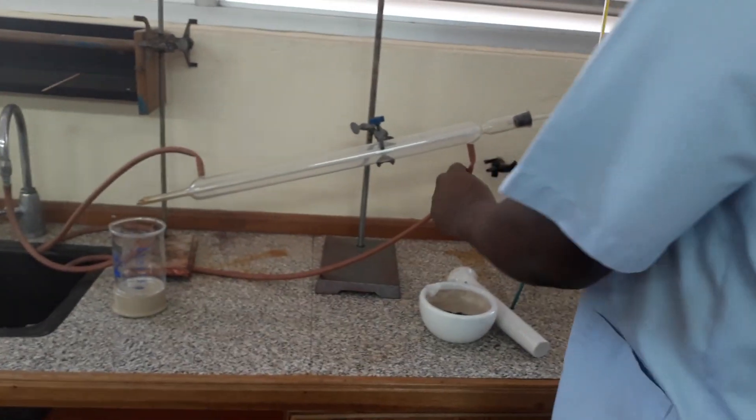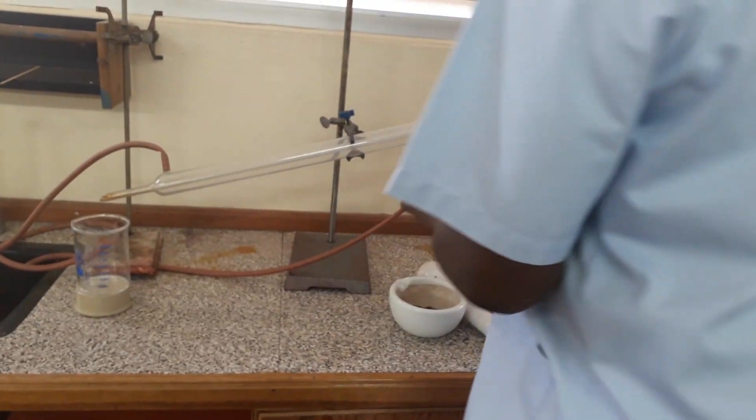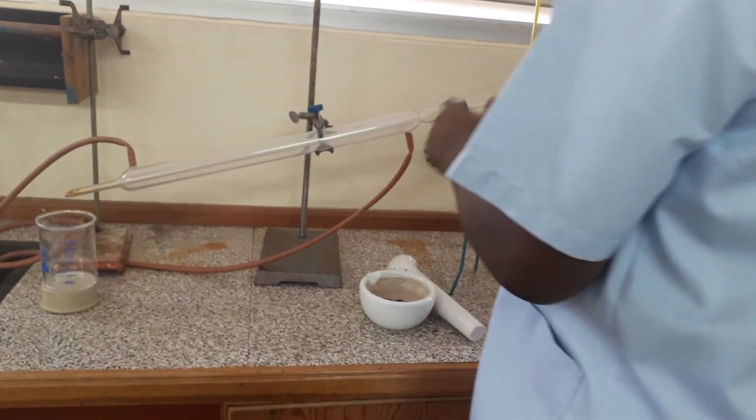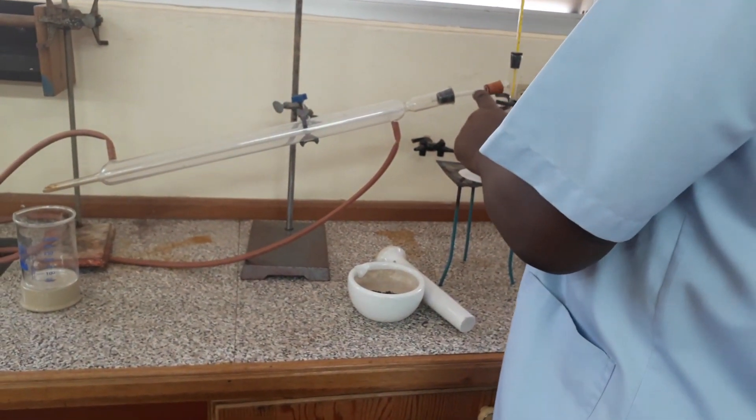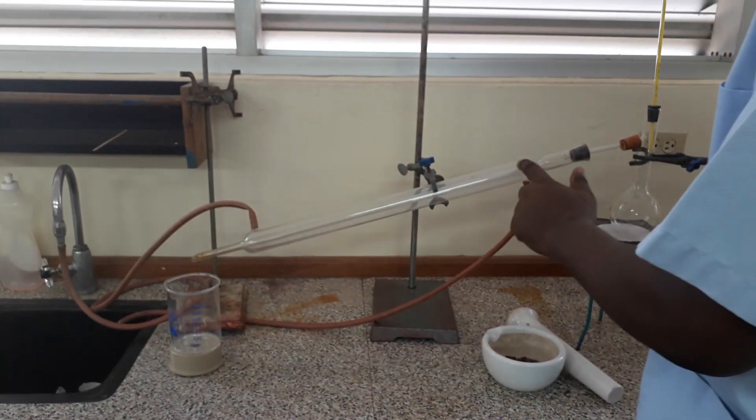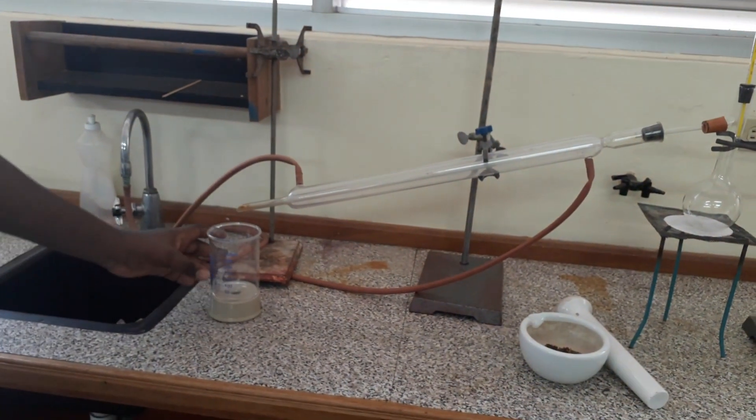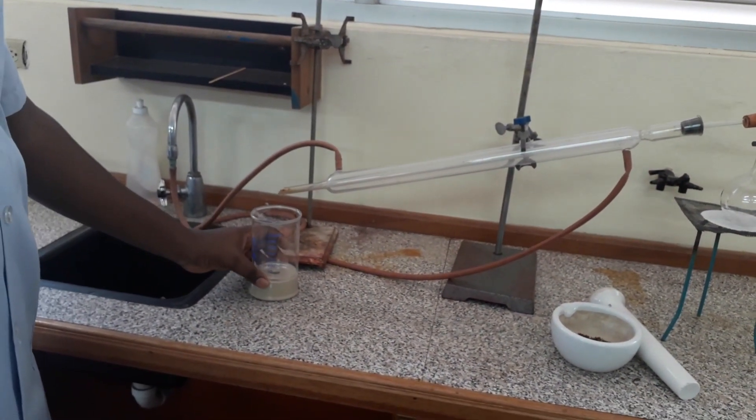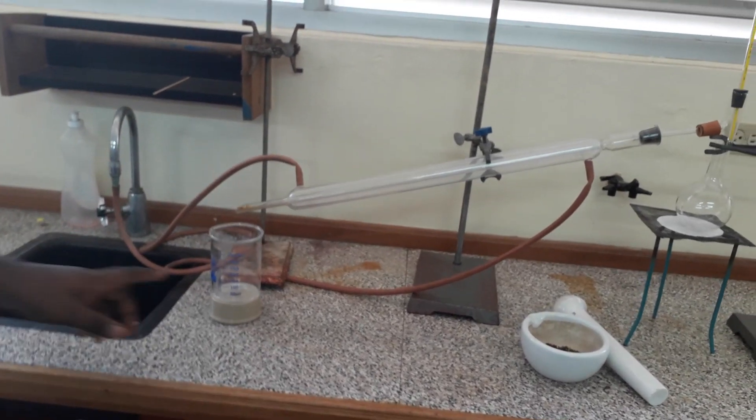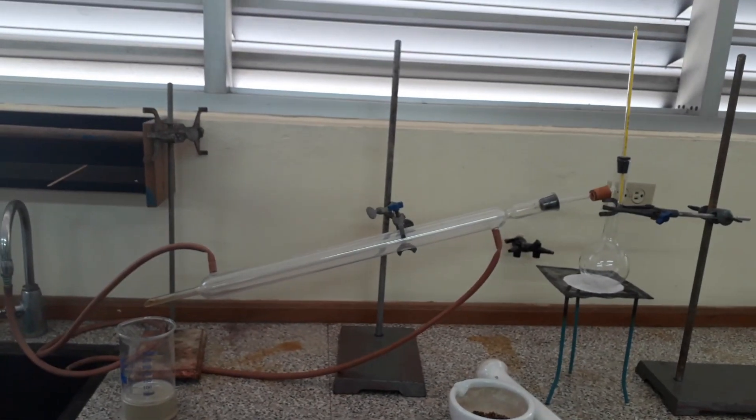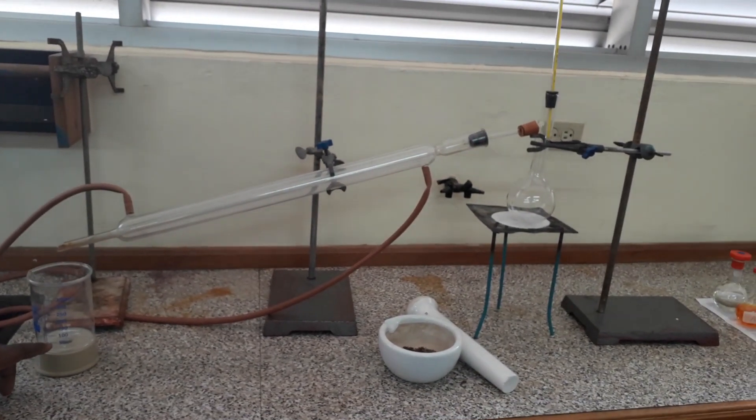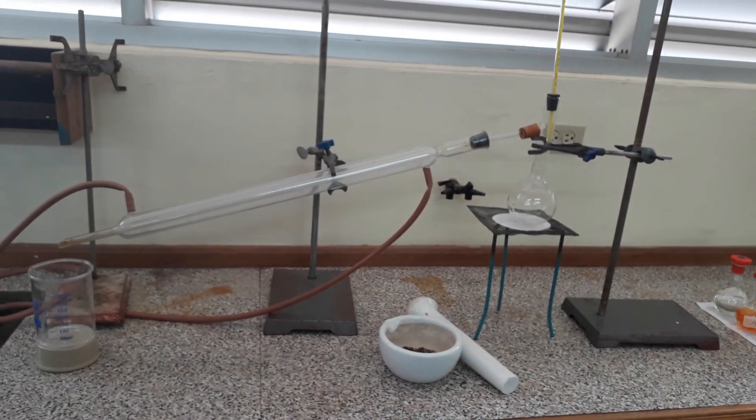As it cools down the vapors of water and eugenol in the inner tube, which will come through the inner tube and deposit into this beaker, which is acting as my receiving flask. And so the beaker will have your water and your eugenol distillate.